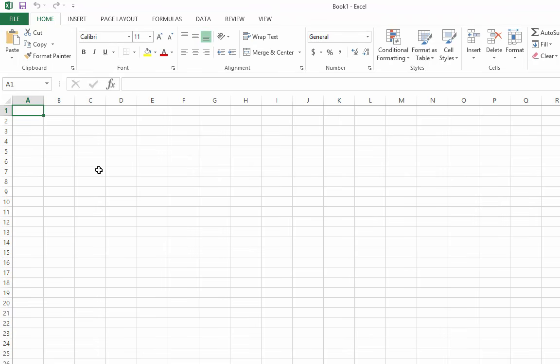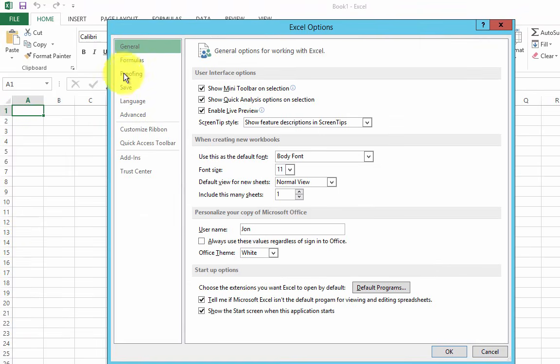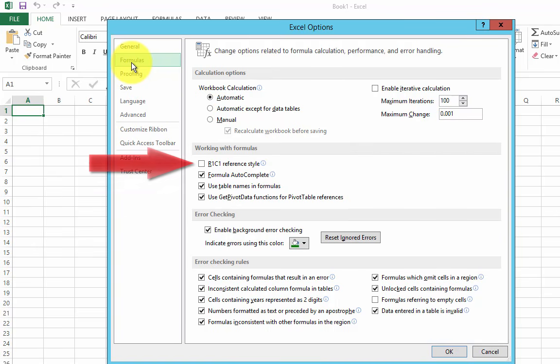I'd encourage you to open your own Excel file and replicate these steps as we go through this video. In order to avoid confusion, please go to File, Options, Formulas, and uncheck the R1C1 reference style. Now our formulas will look the same. Let's get started.